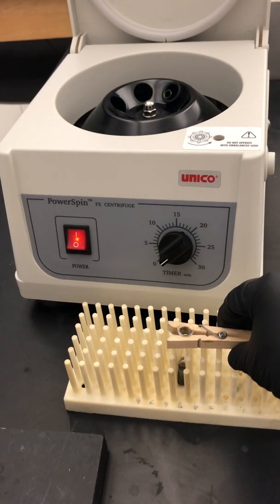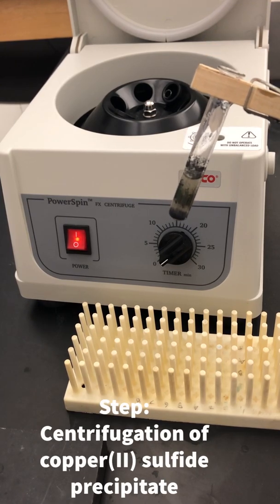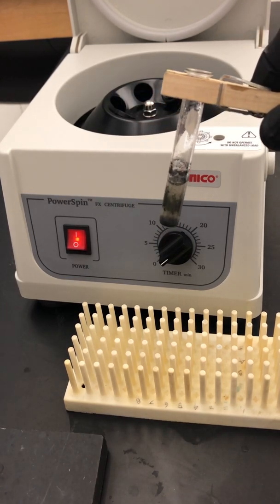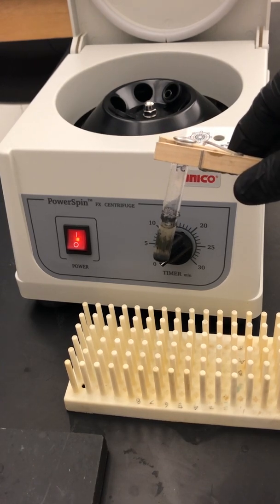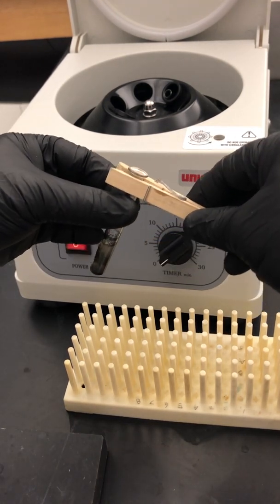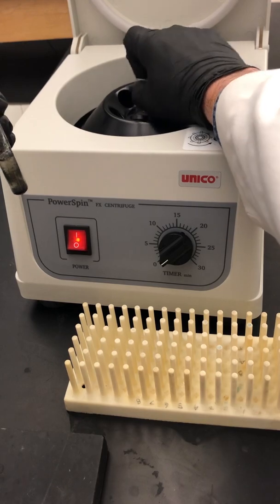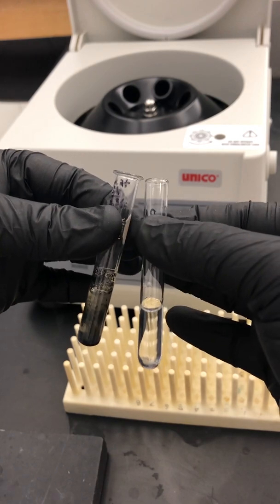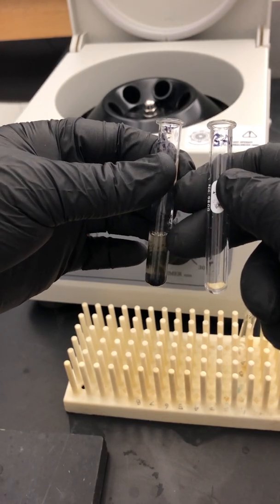We finished our boiling water bath, and here is our tube now with a very dark precipitate, which should be our copper II sulfide. What we want to do is spin this down and compact it into a pellet and decant the supernatant, which at this point should have our iron III cations. Be very quick in doing this because it smells pretty foul because of the sulfide. Also, when you balance it on the test tube — remember the one we did before — make sure you get the right kind of test tube, in this case one with a lip on it.